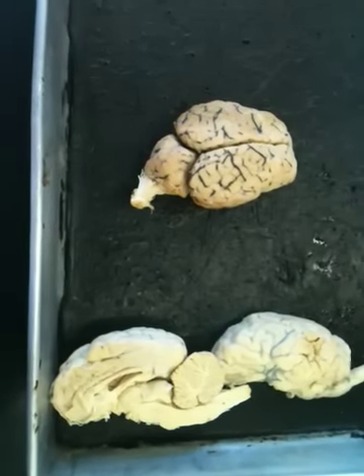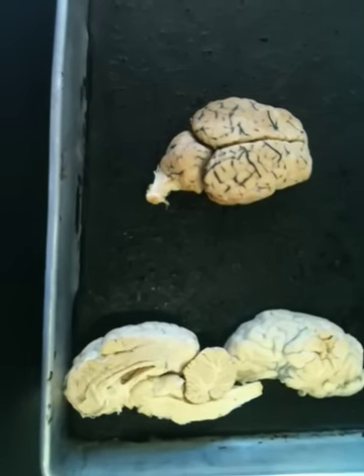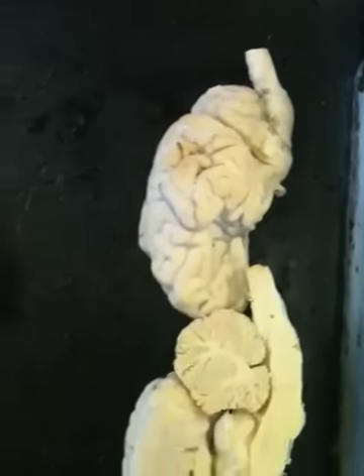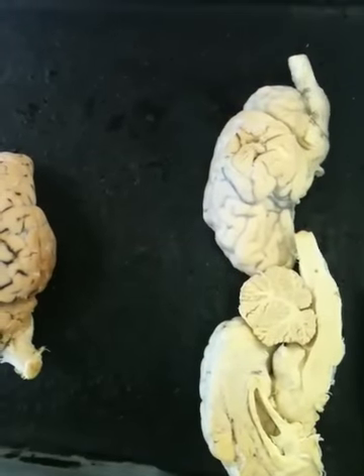Okay, so the meninges, external gross anatomy of the sheep brain. The meninges are the three layers of the external protective layers of the sheep. The dura mater on this sheep you can't see, but in the jar you can see it. It's a thick, external, dense, irregular layer of skin.